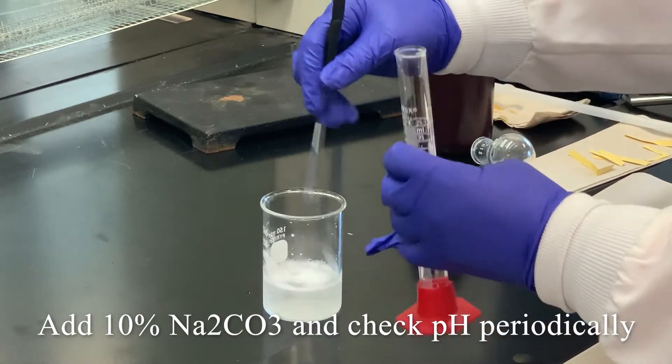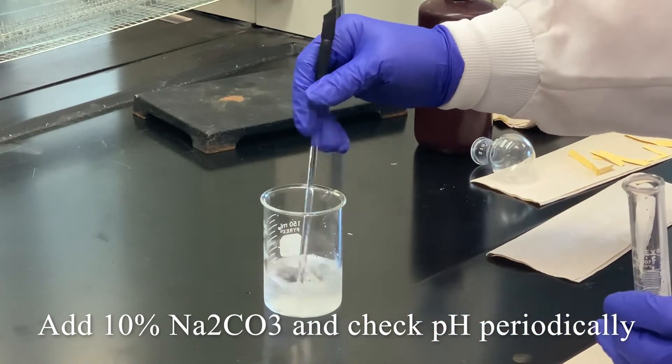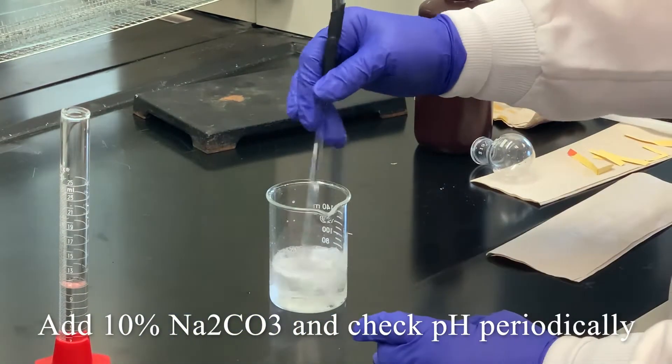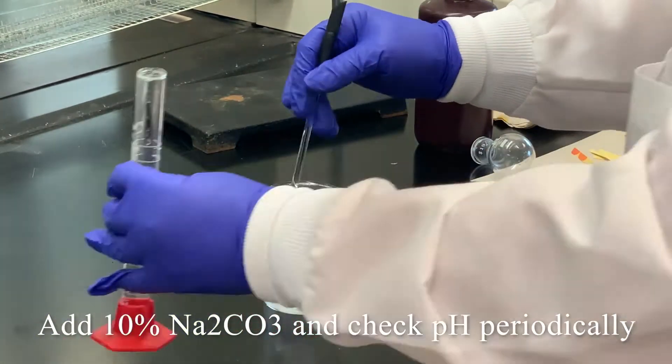Be careful, although we only had a milliliter of sulfuric acid that we used, you can have some frothing to take place as well.